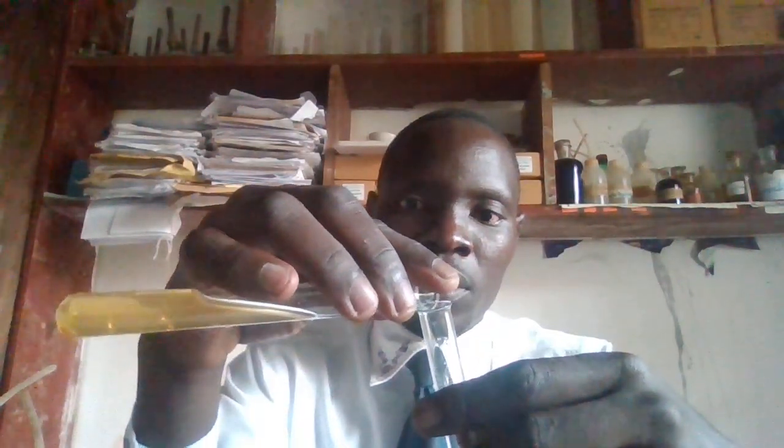So now we are going to look at the reaction of the iron 2 with ammonia solution. But what could be the observation? So we're going to look at some bit of the solution. I'm going to divide it into portions. This is still a solution of iron 2 ion.